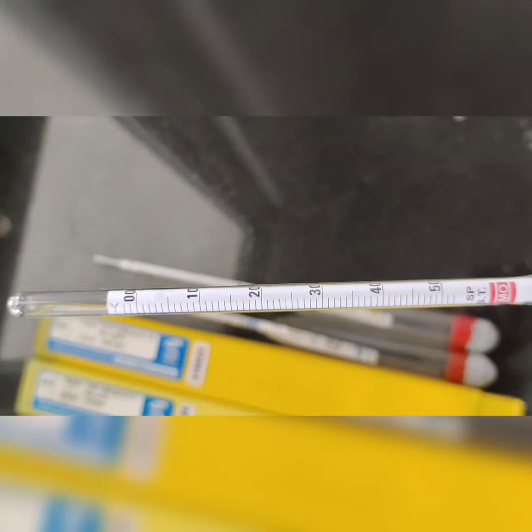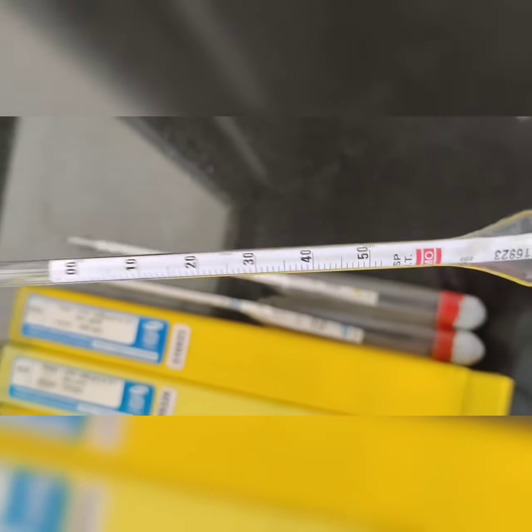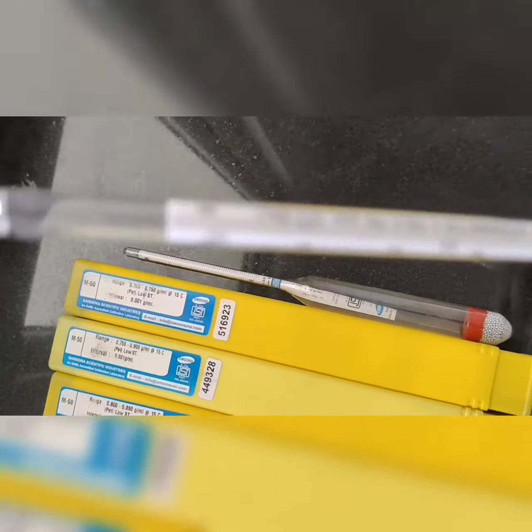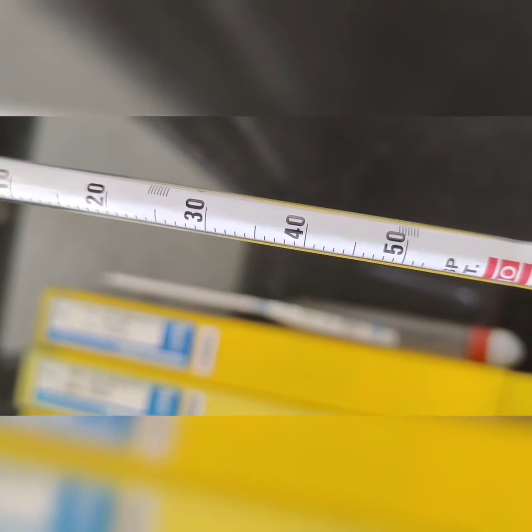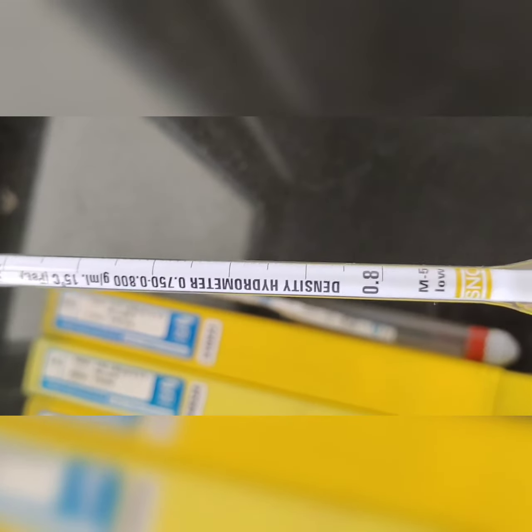Okay, then you can see this one. Here you are having the 0, 10, 20, 30, 40. This one is one type. This one is the second one. For the first one you have seen from 700 to 750. So here 700 to 750, and in continuation of that you are having this one, 750 to 800.